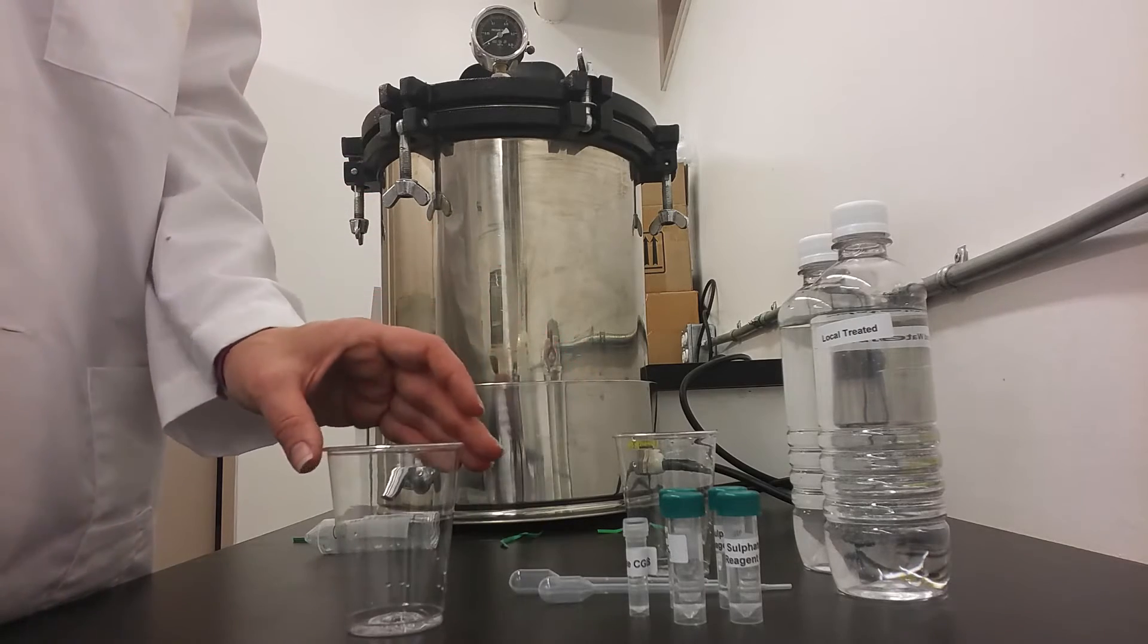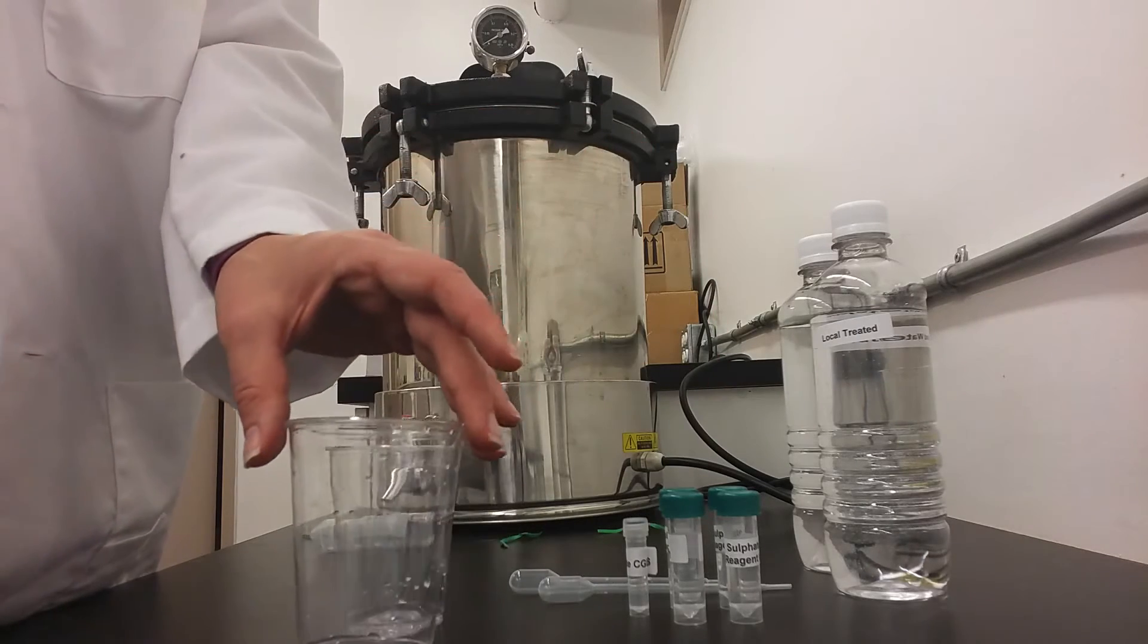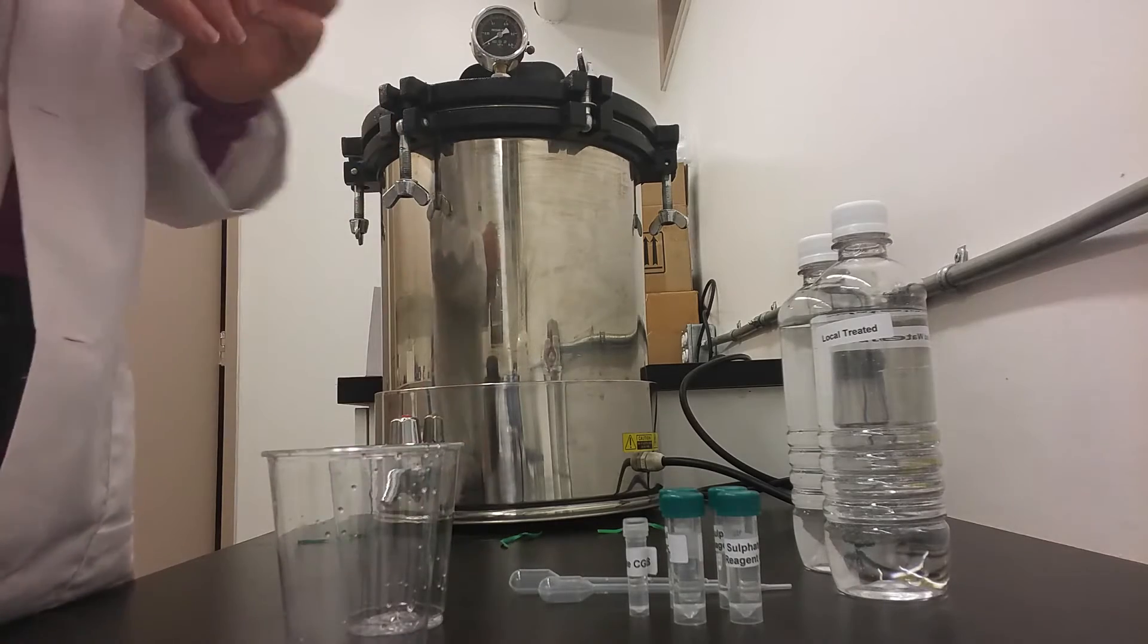To begin with, you will measure 25 milliliters of deionized water into both of the empty plastic cups.